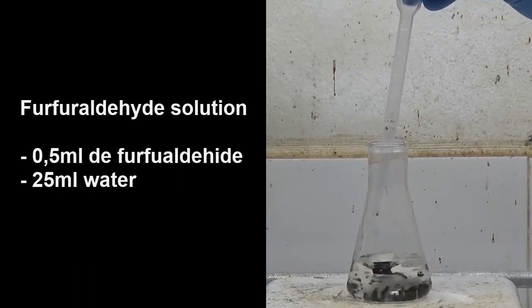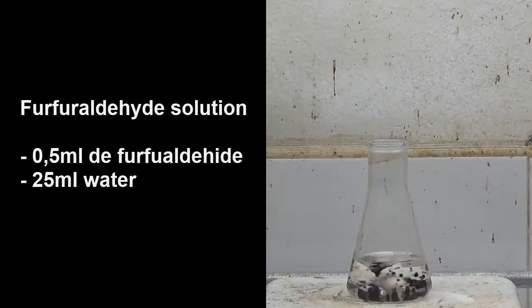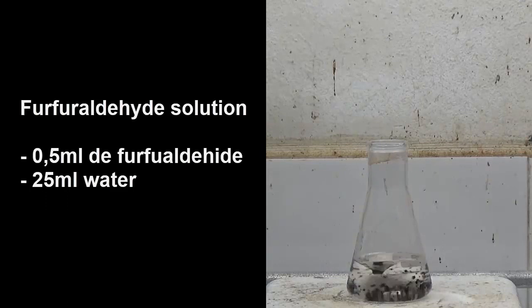First, we will prepare a dilute solution of furfuraldehyde, dissolving half ml of furfuraldehyde in 25 ml of water.